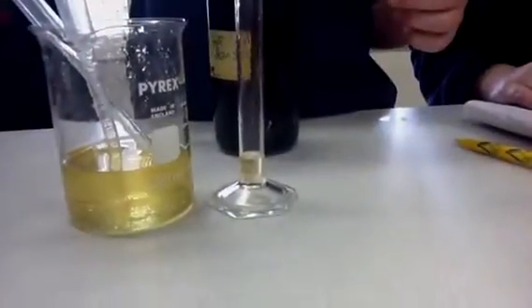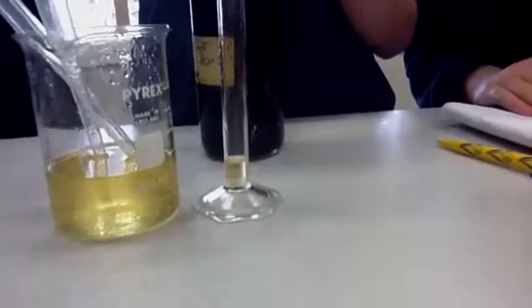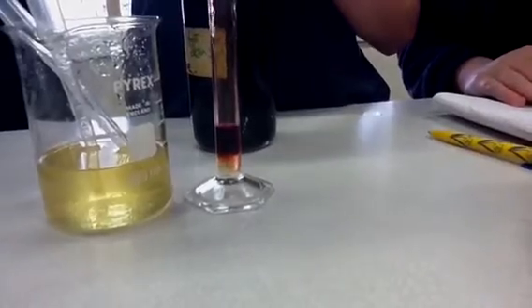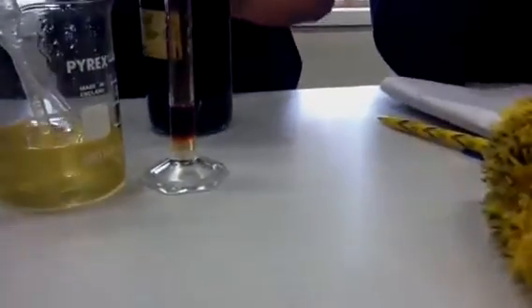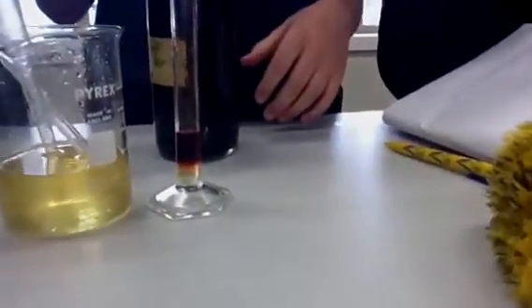We haven't tried that yet. But when you try it, try and predict what would happen. Float or sink? It's going to sink. Actually, float. So it floats? Yeah, I knew that. Because the number's lower, so things with lower numbers should float on things with higher numbers. Hexane will float on oil.